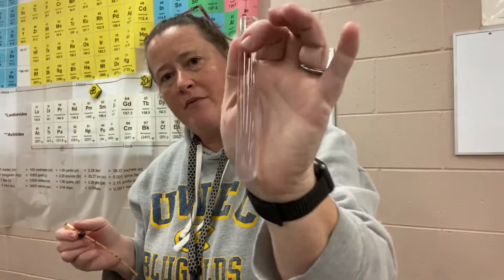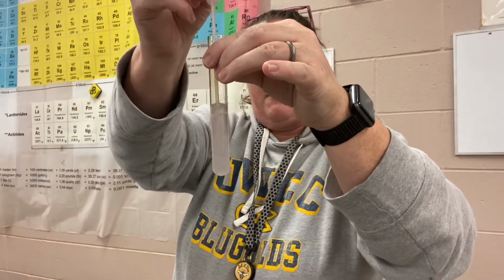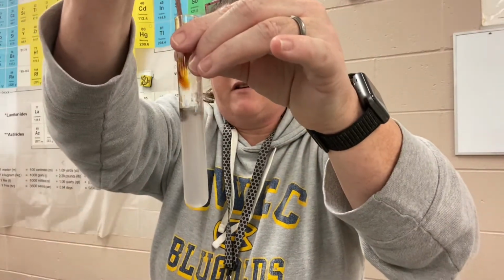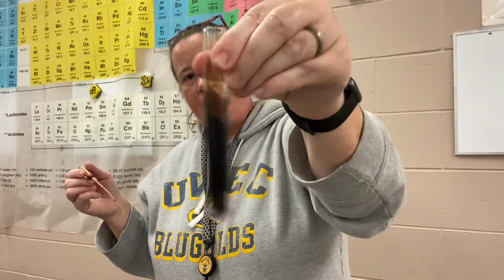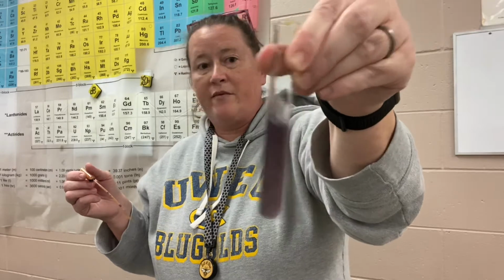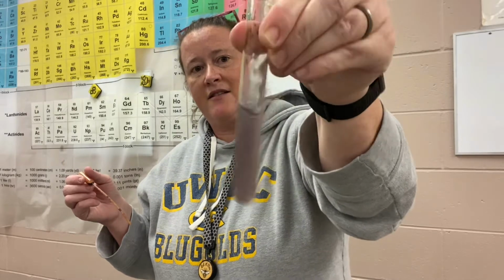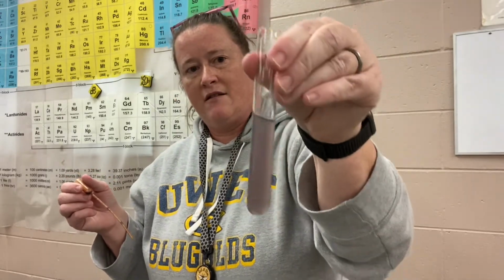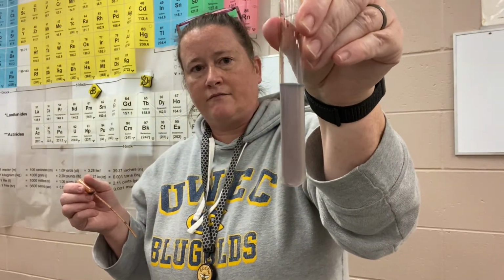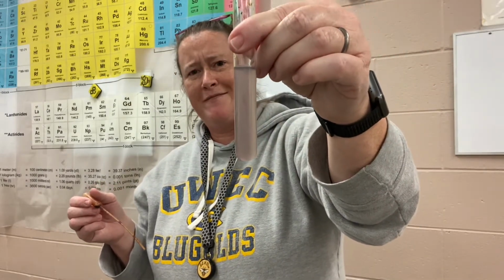And we have a purplish color now. I don't know if you can see it with this background or not. This one is definitely really, really close. The purple is lightening up again. If it goes back to completely white, it means that I still have not reached my end point. Let's see. I think it has kept a permanent color change. Maybe.